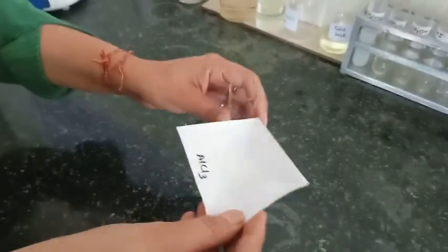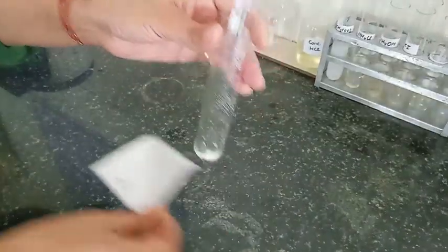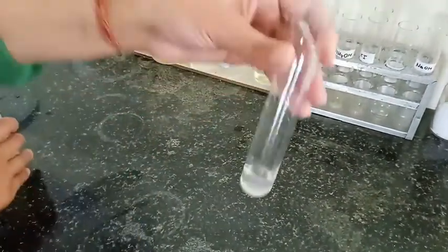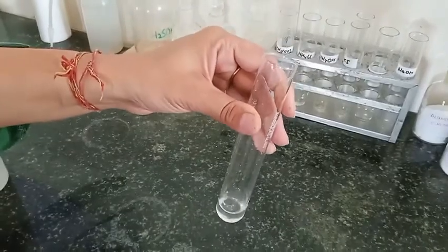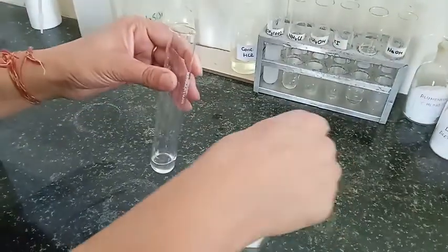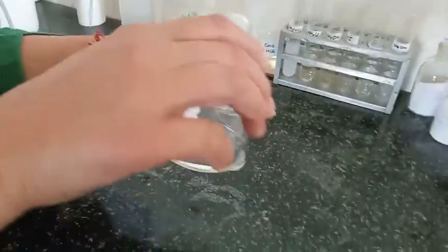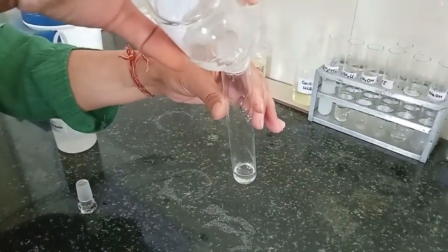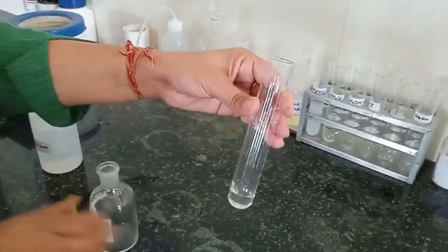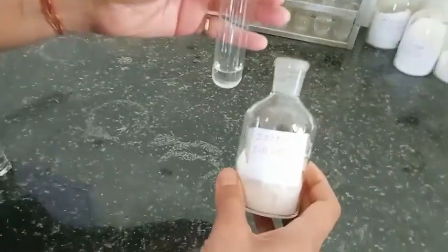For the group test I have taken aluminium chloride salt, which belongs to the third group. I have added distilled water to this and here you can see we get a clear solution. So we are going to use this as the original solution. For the group 1 test we are adding dilute HCl.